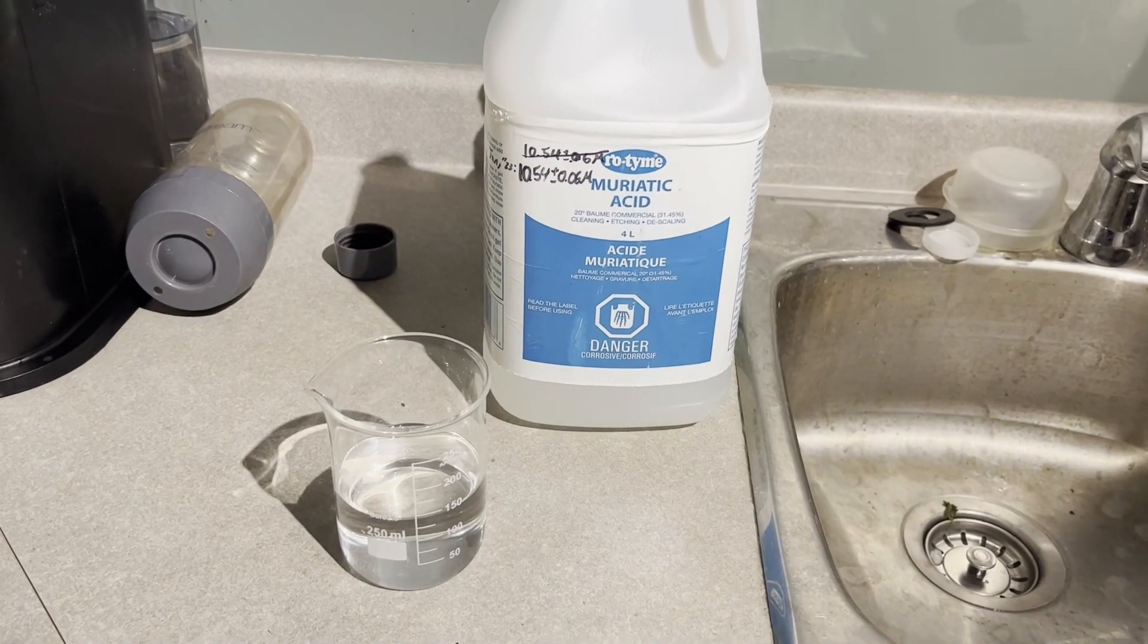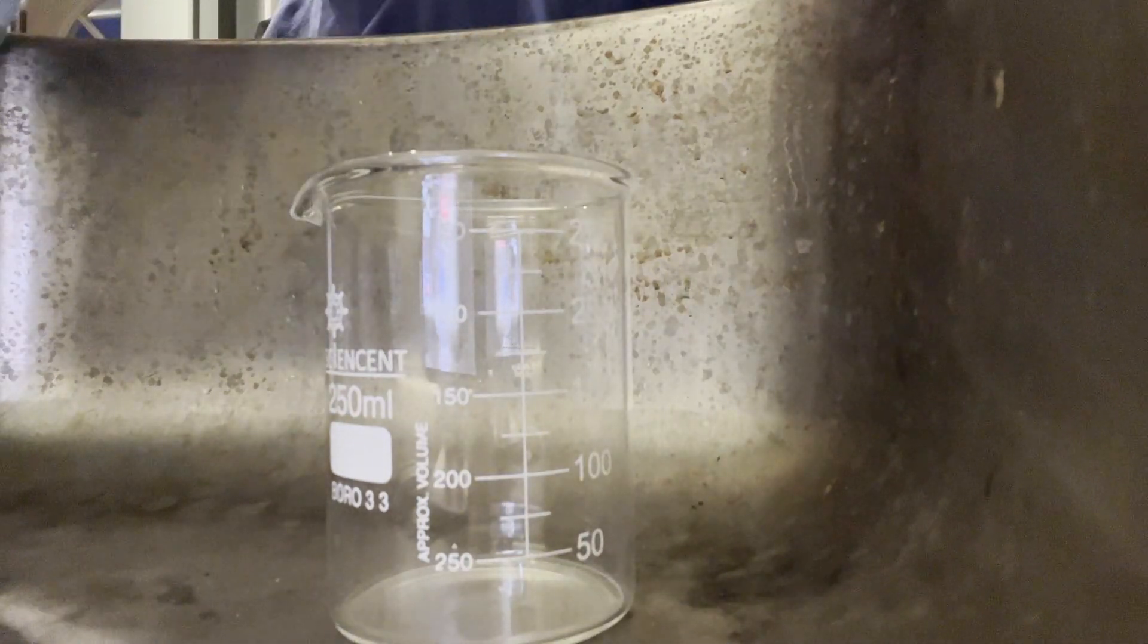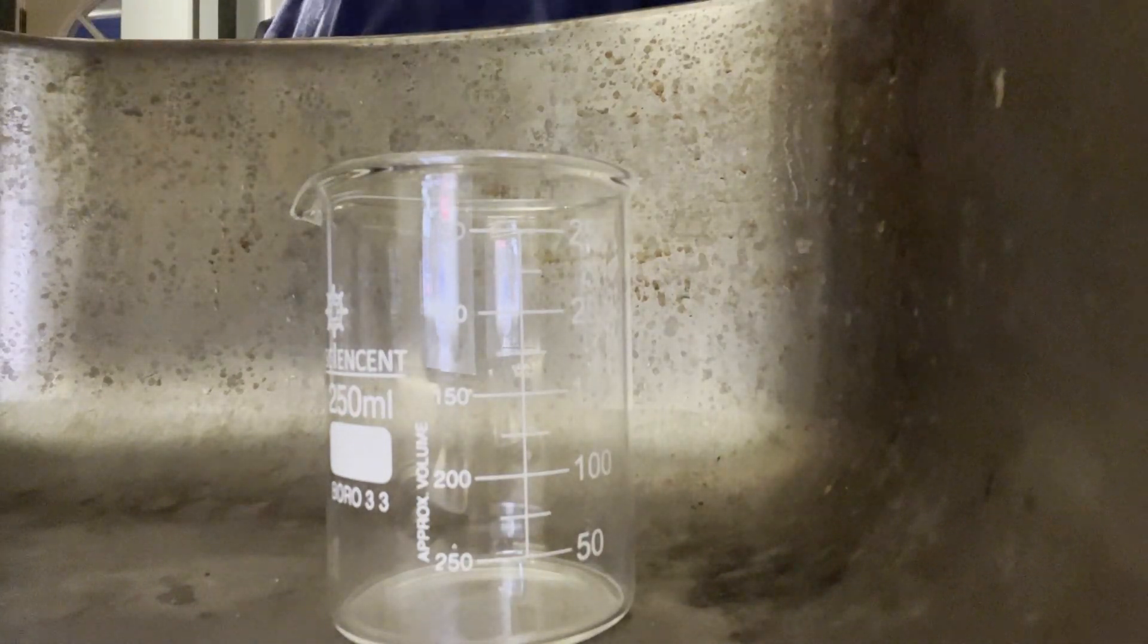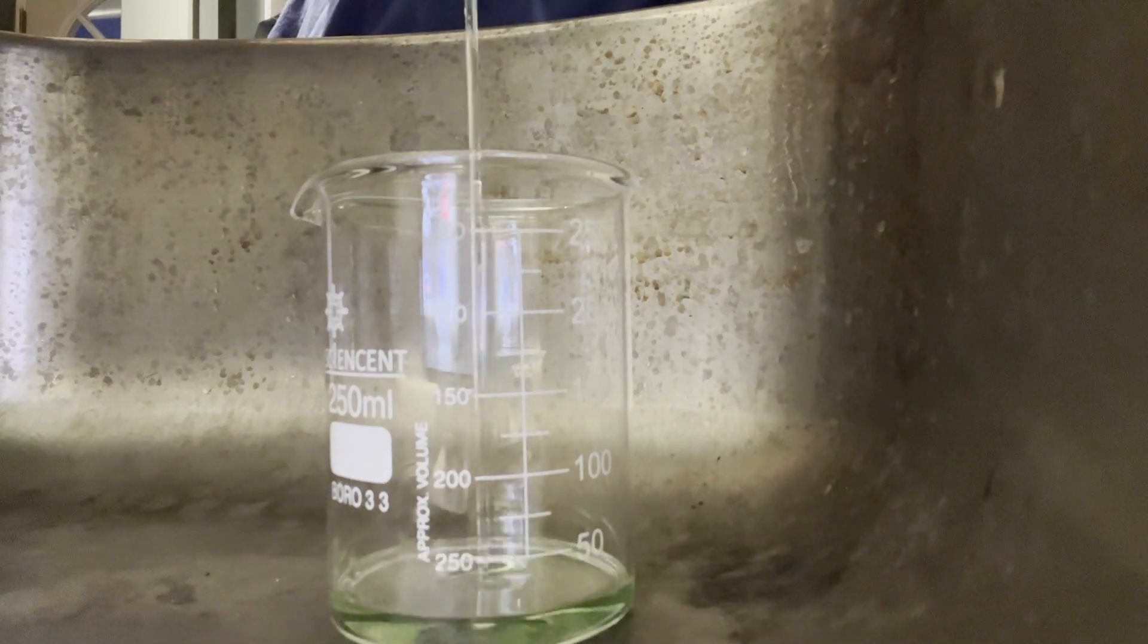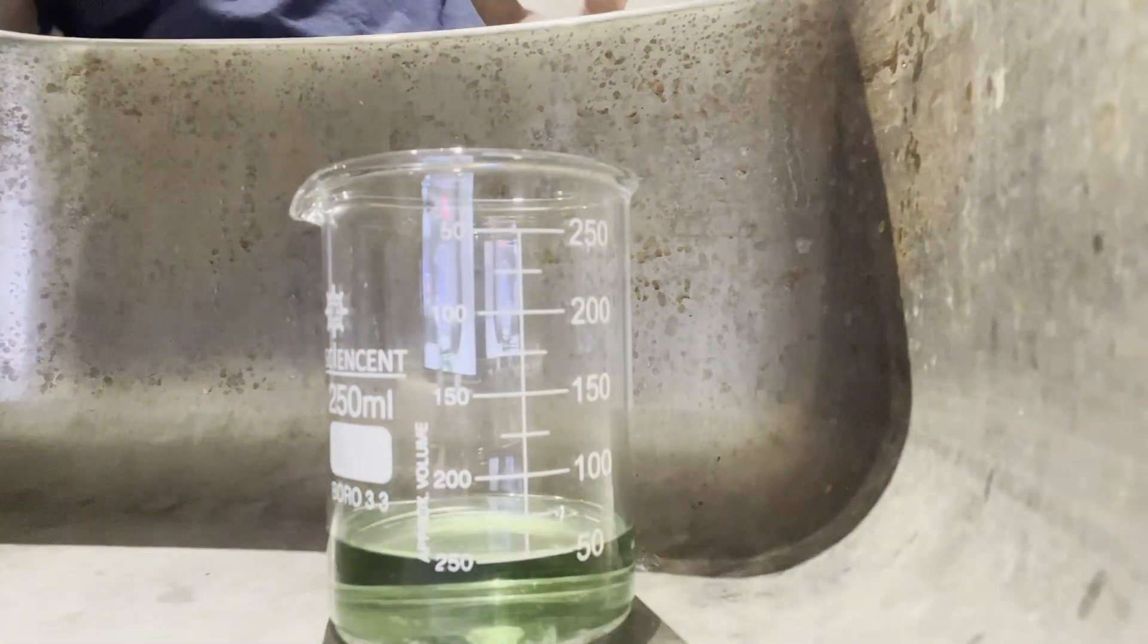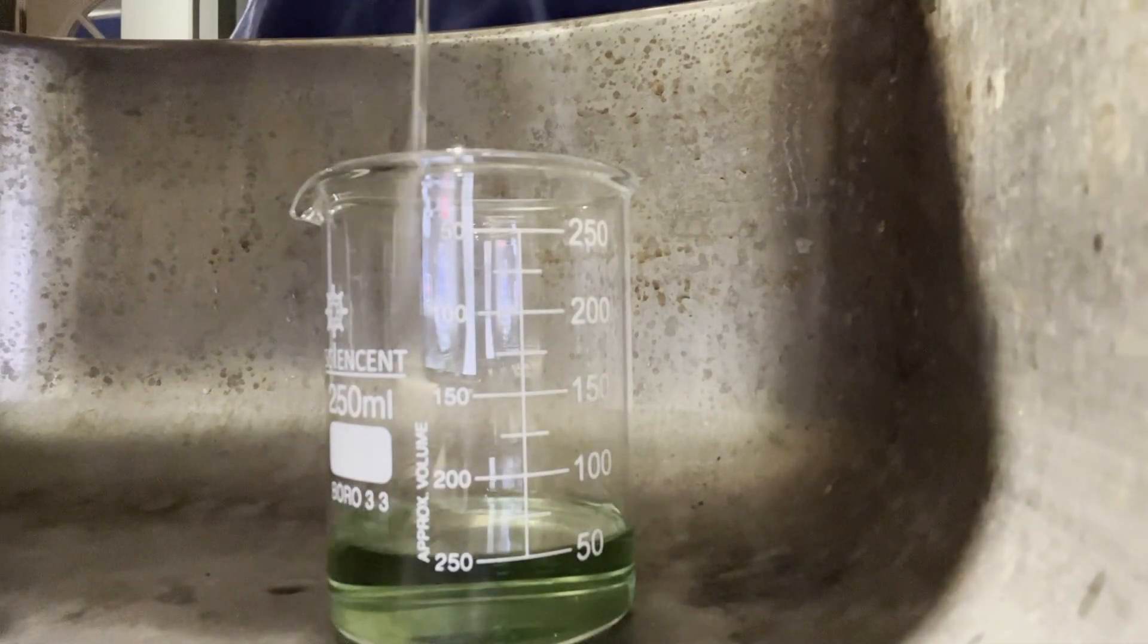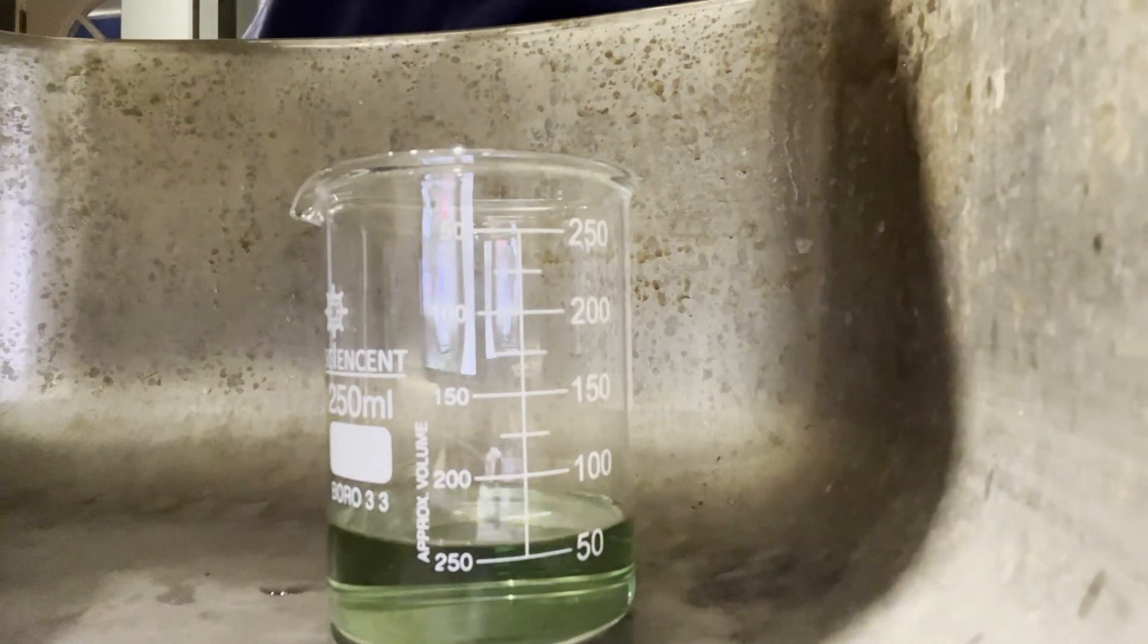About 150 milliliters of hydrochloric acid was poured out and sent into a freezer. Next, the sulfuric acid was poured. Some people do only sulfuric acid such as the tutorial by NileRed, but doing it this way will lessen the salt load and give you a much purer product, allowing for more to precipitate. I used an impure form of sulfuric acid, just straight drain cleaner. Works just as well.